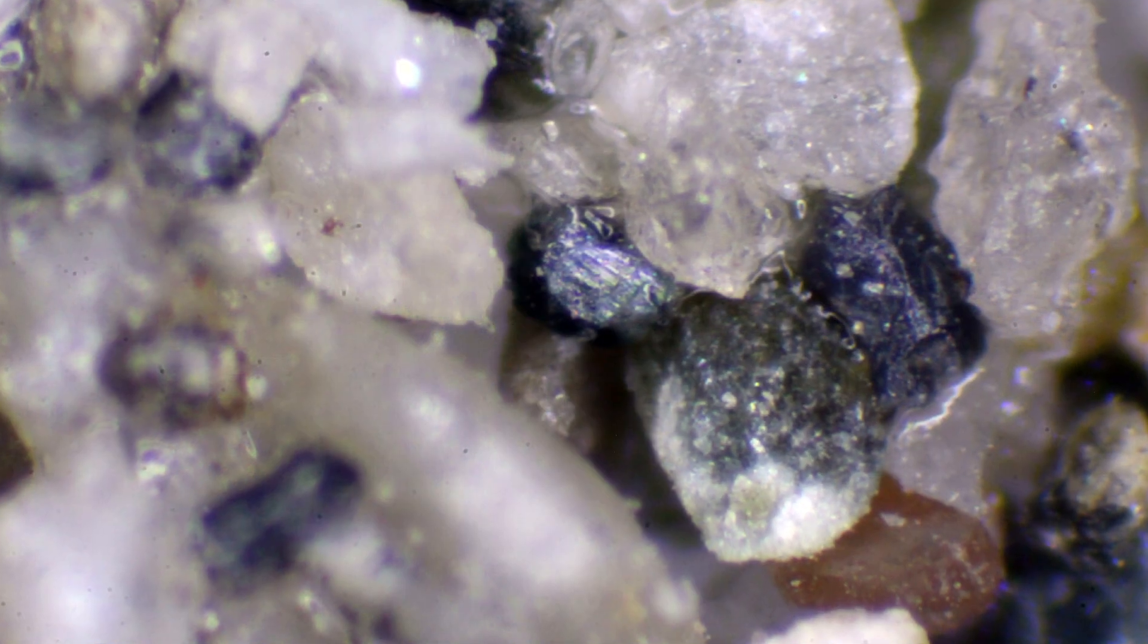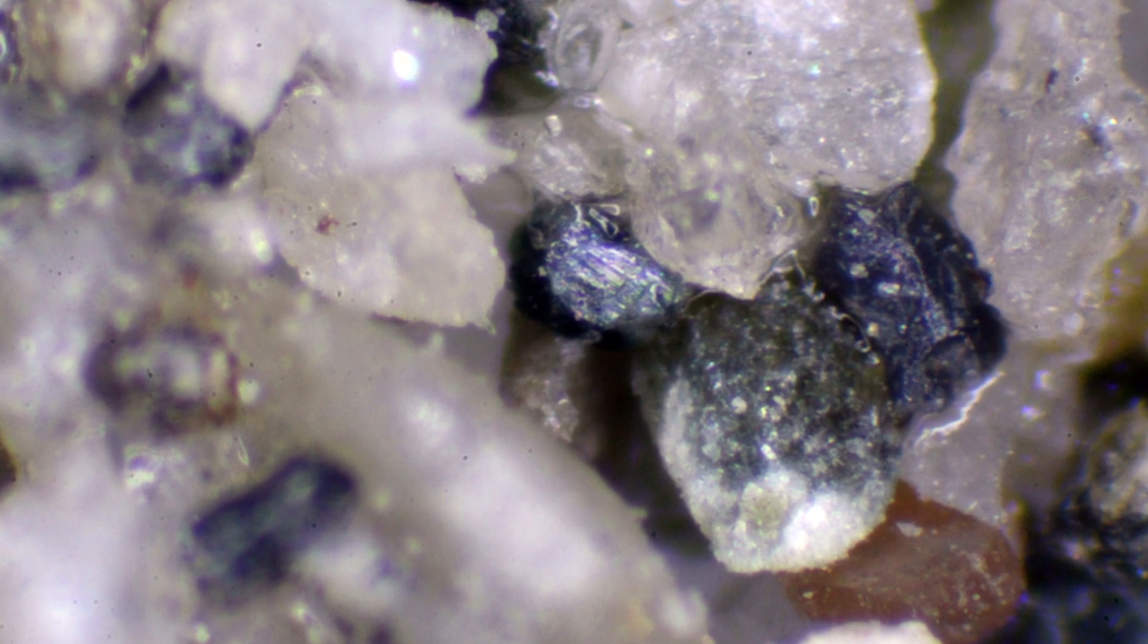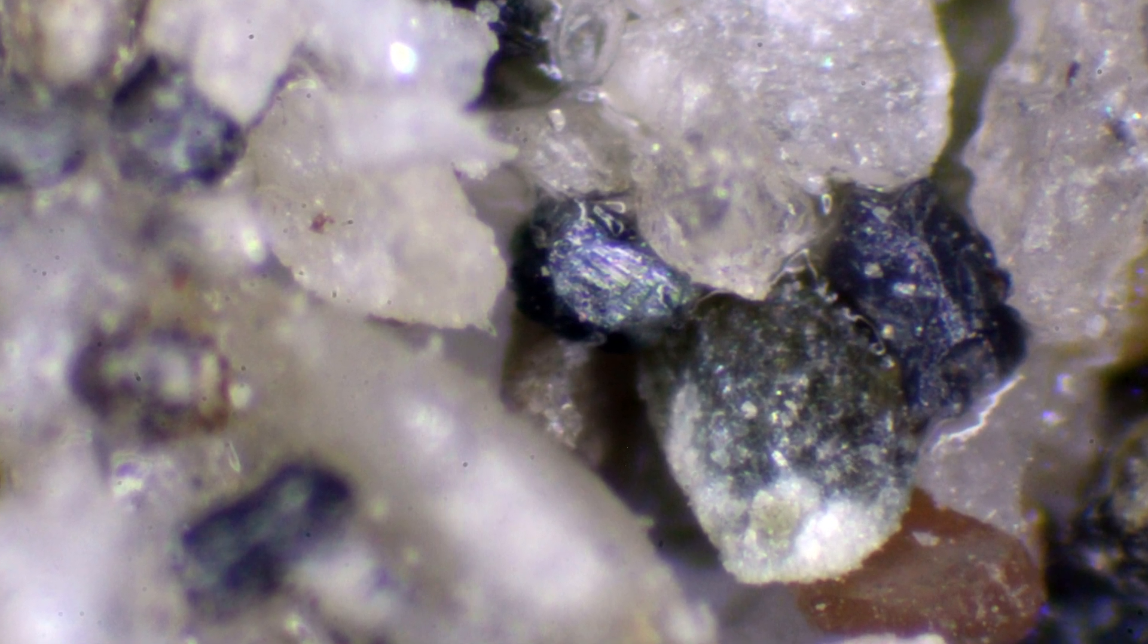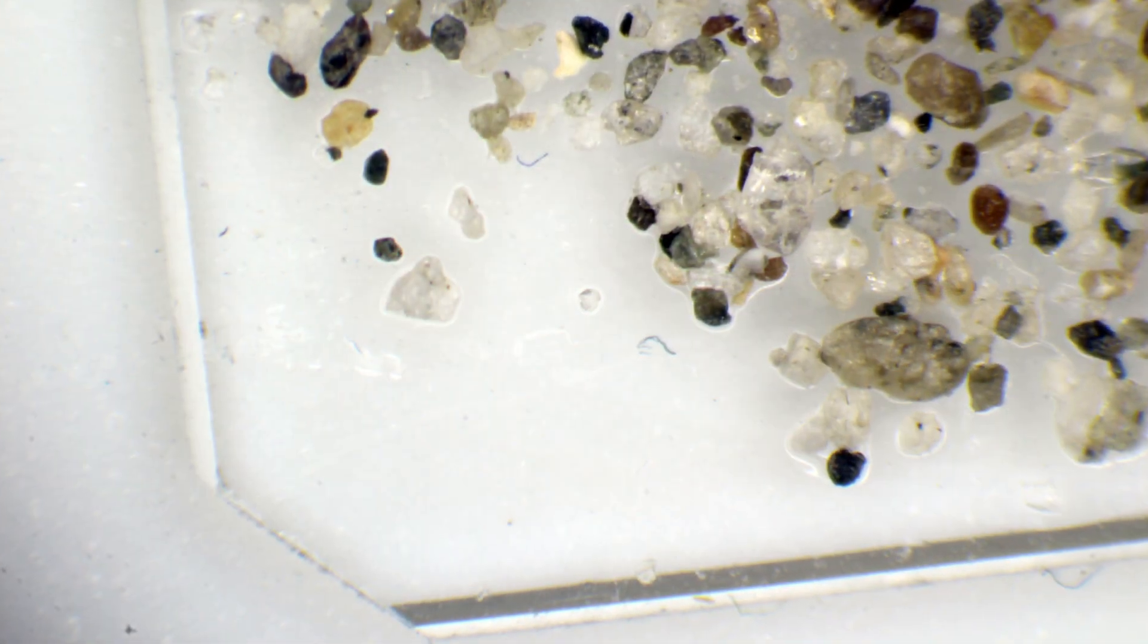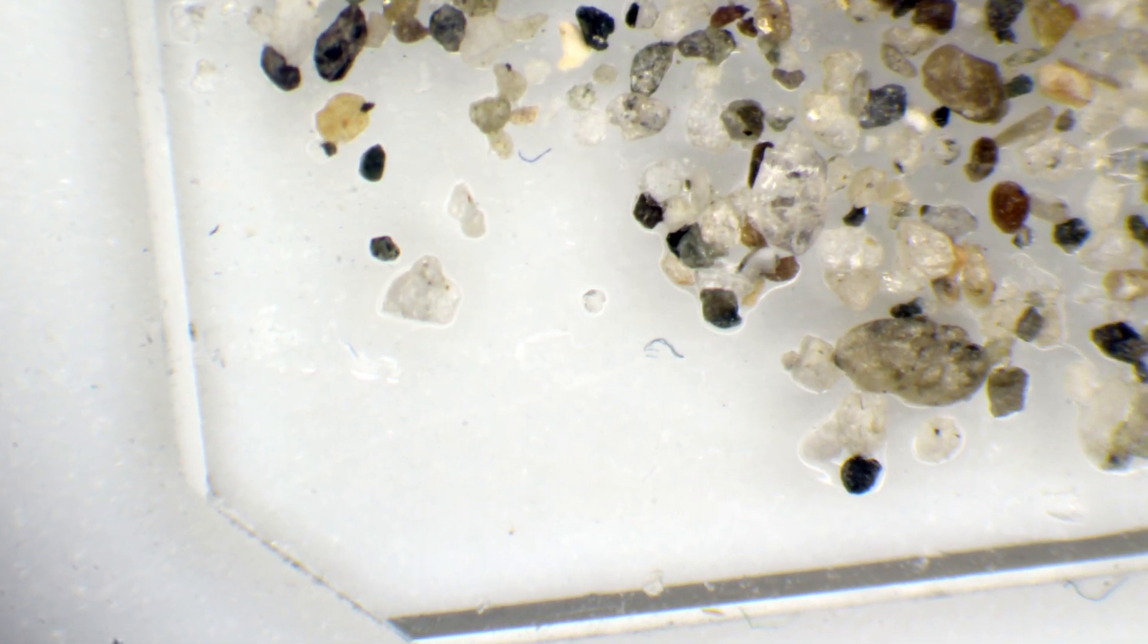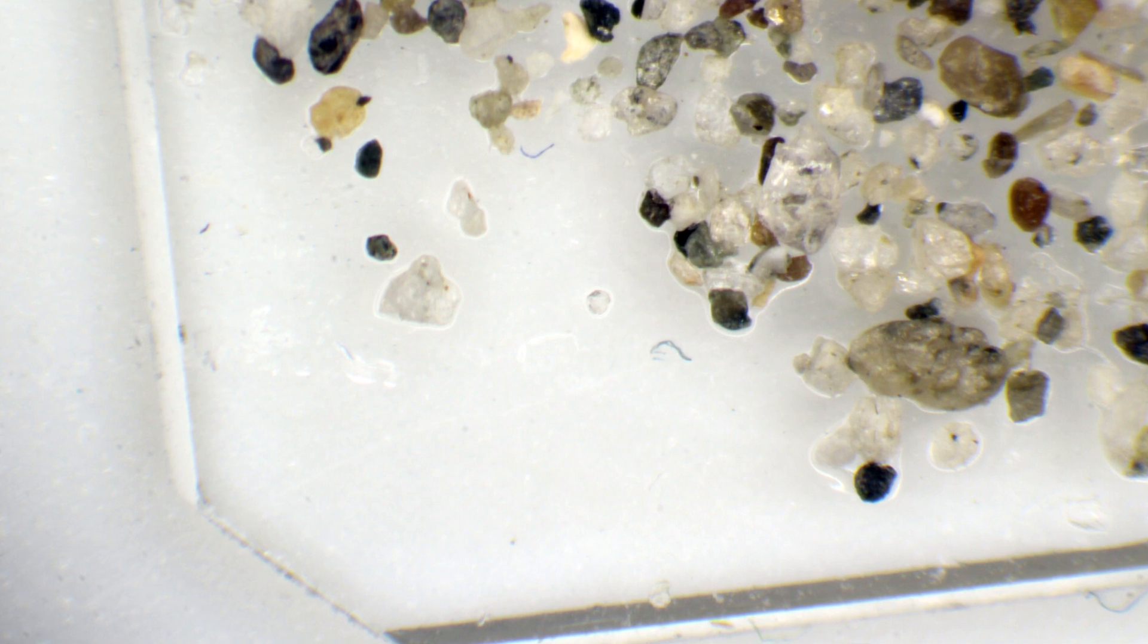And I think this is a very good method to actually prepare sand slides. So now this is the place where there's the nail polish and you can see that you can almost not see the nail polish at all.